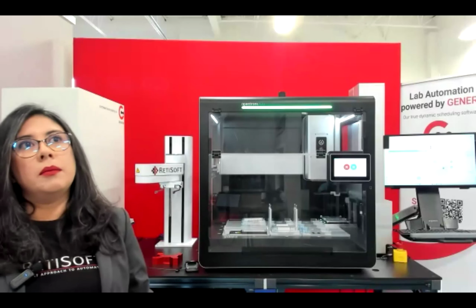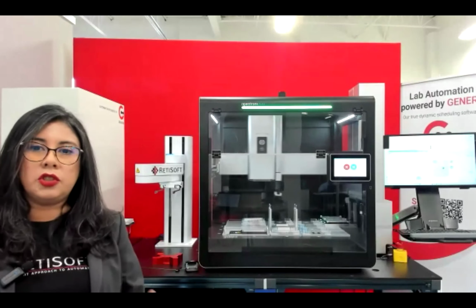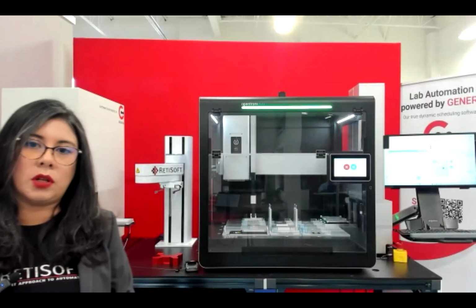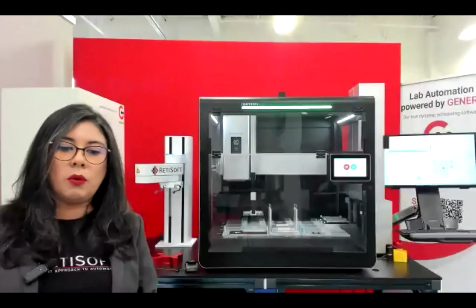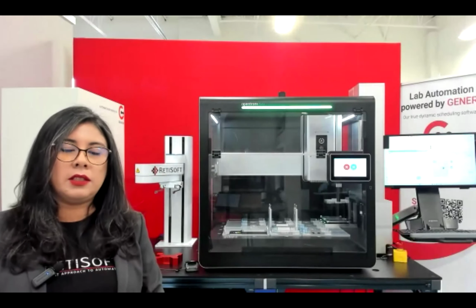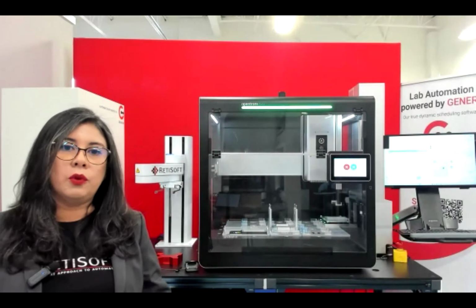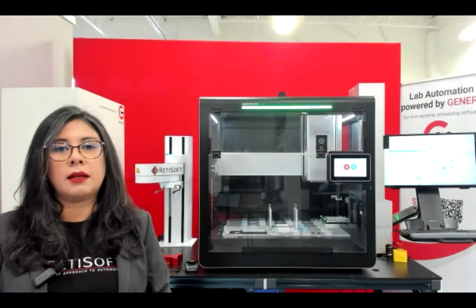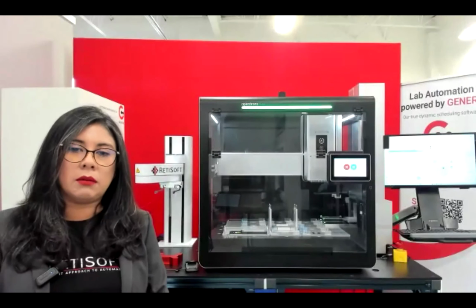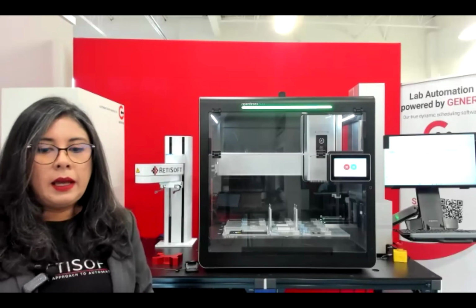One of the benefits of that is that you can easily configure the system and then teach your positions and add equipment as you are growing with your workflow and your work cell as well. So we will basically provide that together with Genera. It's embedded in Genera. Igor will show a little bit about the teach pendant, but we also have done a full webinar on the teach pendant capabilities. So if anyone is interested later on, they can contact us and we can give you a demo of how Genera integrates with the Precise robot.